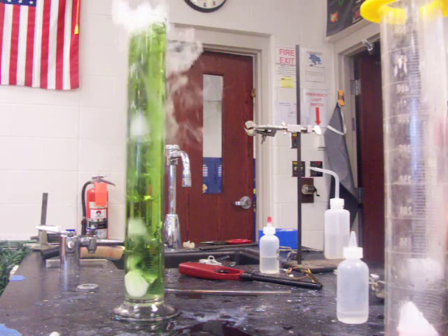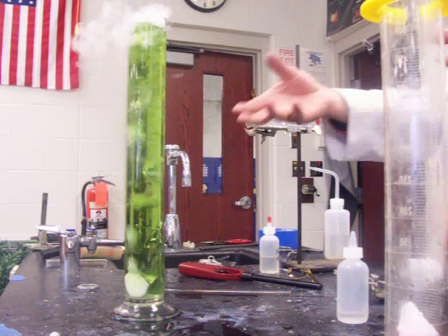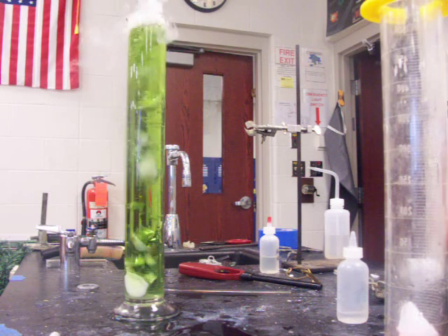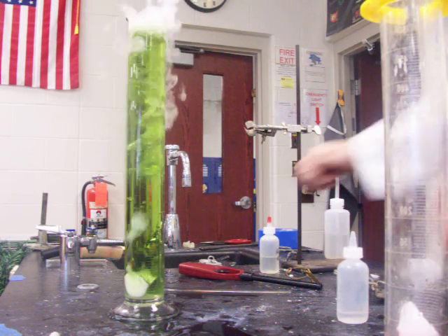If I could get the dry ice out, I could have it paused there. It's tough to get the dry ice out. Now I could also pour the liquid out, I suppose — that's the easy way to do it. But I want to see it go all the way.